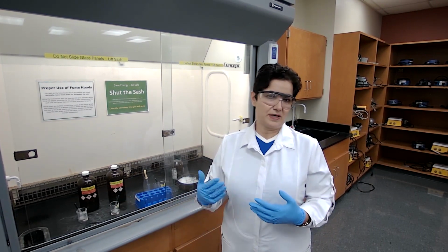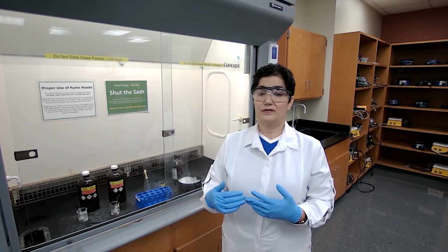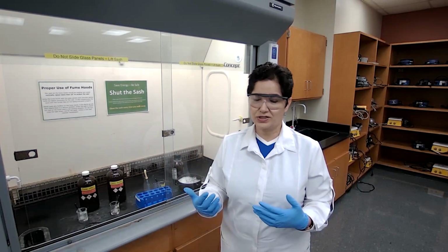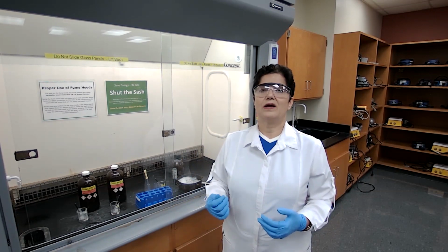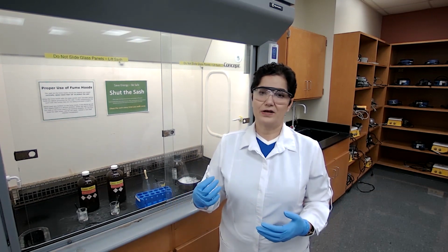First we are going to measure the chemicals, mix them, and find the final product. We isolate the final product, clean or wash, and dry it, because in this case it's going to be a solid compound. Measure the melting point, and using the melting point, we compare to the three possible products, ortho, meta, and para, of the final product. We can confirm the product is meta.